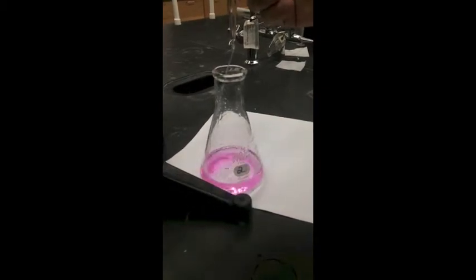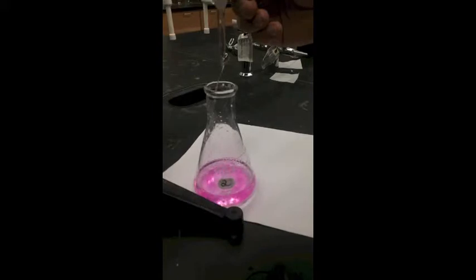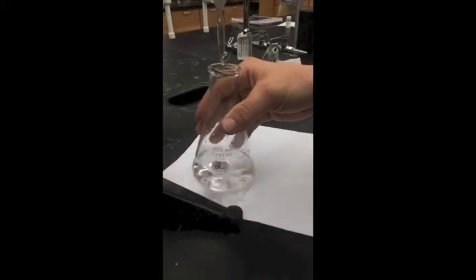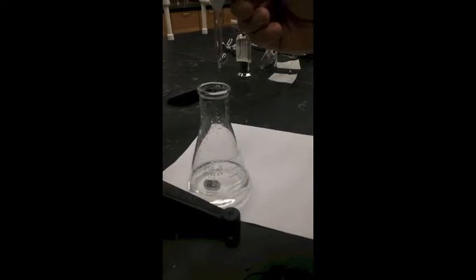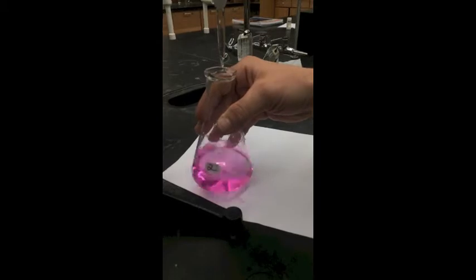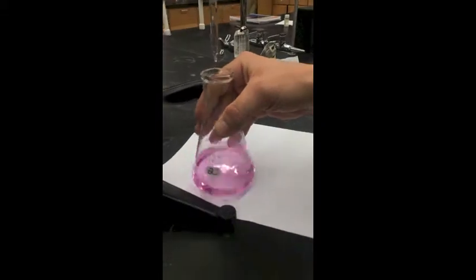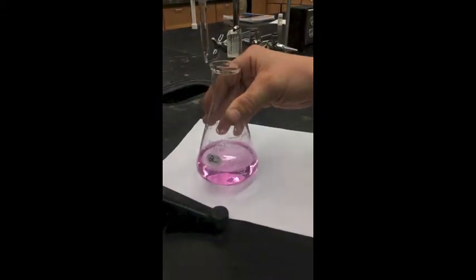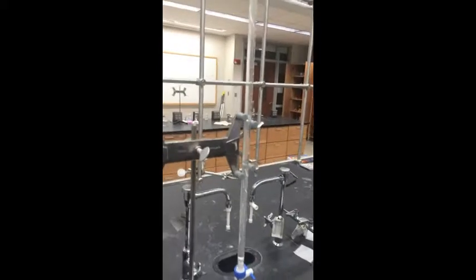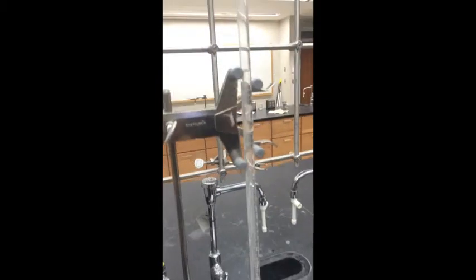Getting closer. Our final volume of the NaOH is 26.3.